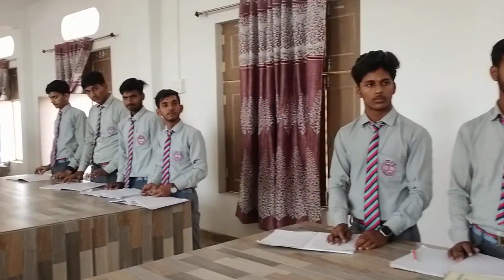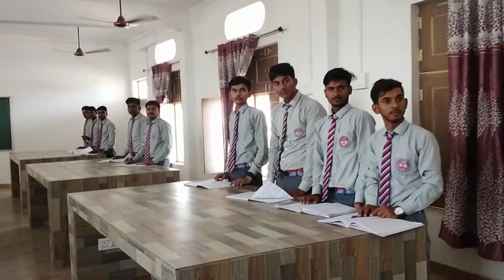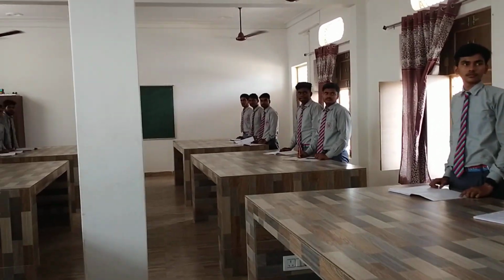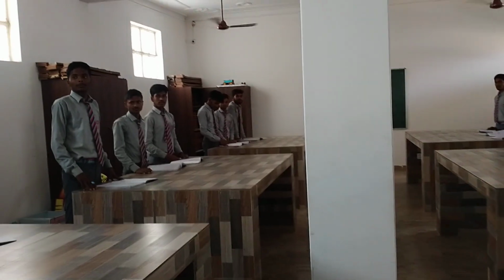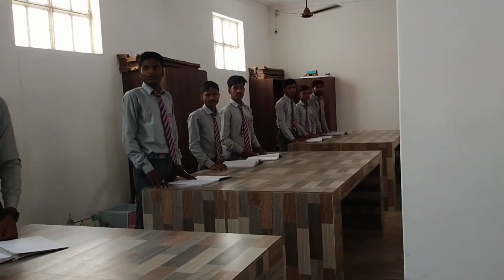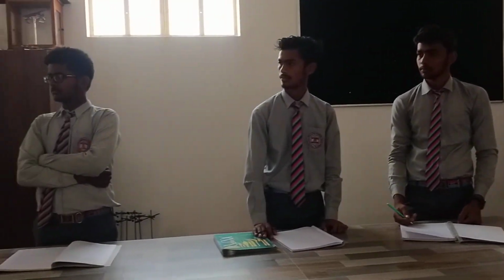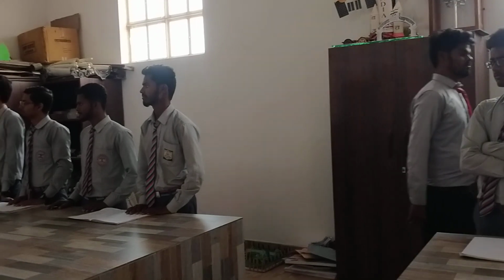Then a cover slip, and so on. Two extra things we can need. So these are the main raw materials. There is a special group of chemicals we need to prepare the nutrient medium, which we will discuss in a further slide or further topic.